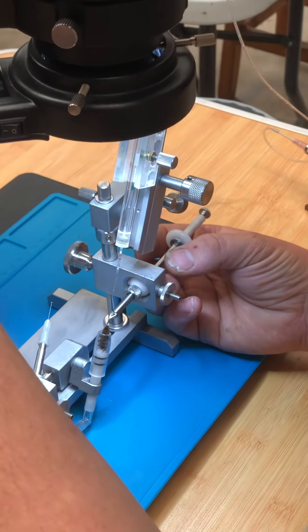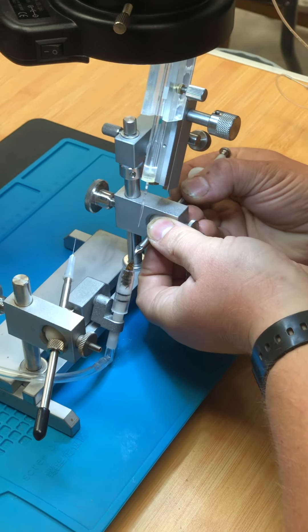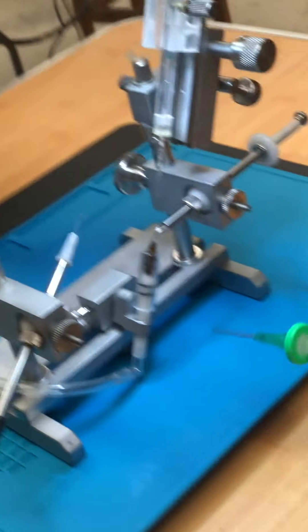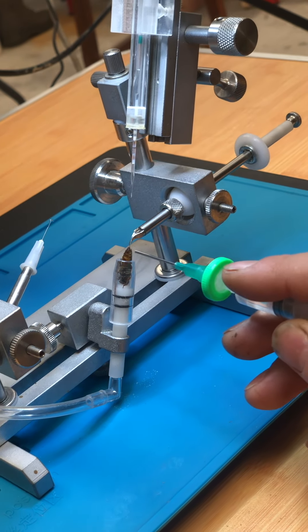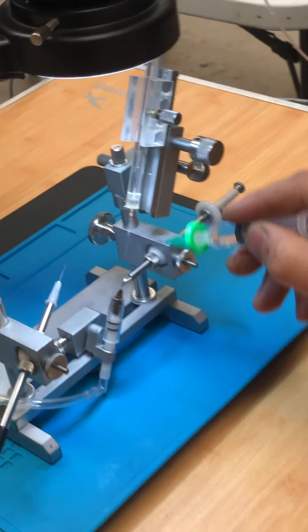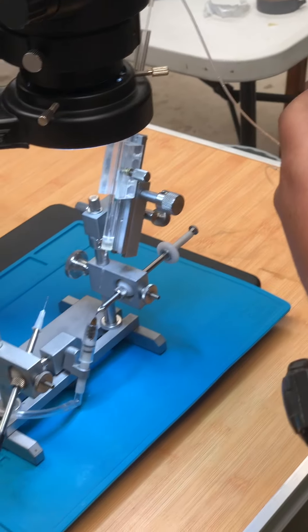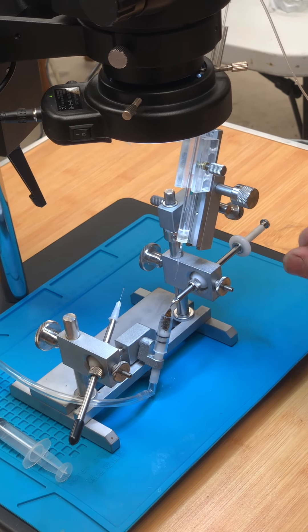Refocus and refocus the camera. To make sure you've got her in the right place, just bring that sting back and tweak — pull it back a little bit more. Her back wants to be nice and straight. You can see how her back is all lined up nicely. If you pull her too far she'll bend over; if you don't pull her far enough she'll be bent backwards. You've got to make sure it's straight because her genital tract is going to be straightened out, and bear in mind this is a very straight object you're trying to get in her — getting a straight object around a curve is always difficult. You don't want to be trying to bend the tool around the curve of a genital tract, or you'll hit resistance and there's a temptation to force it through and damage her.